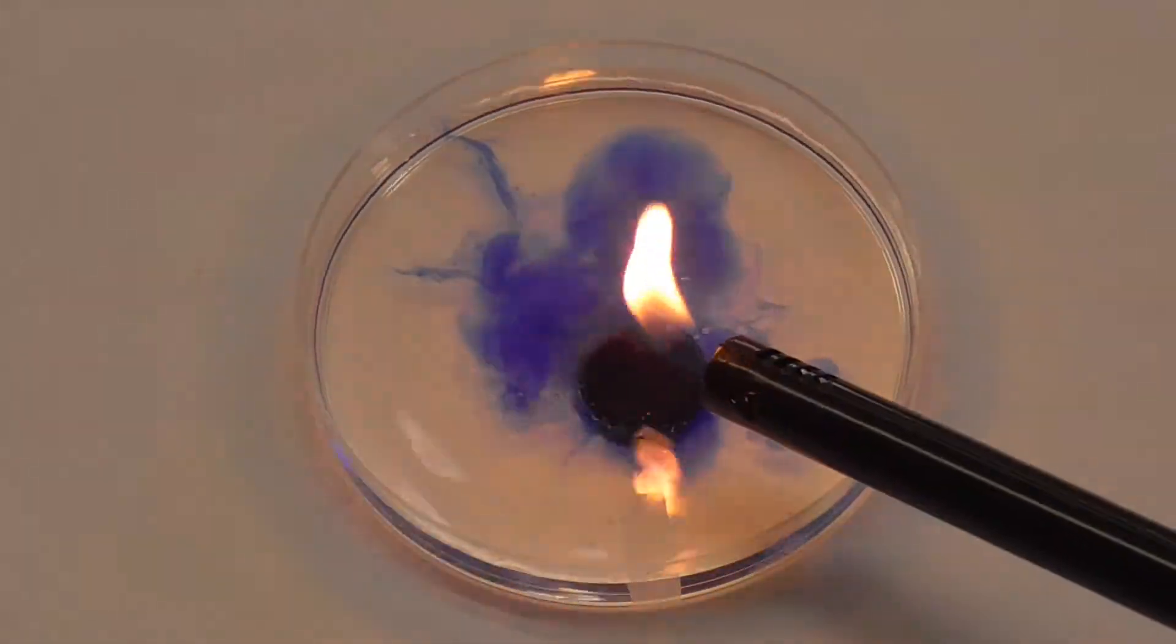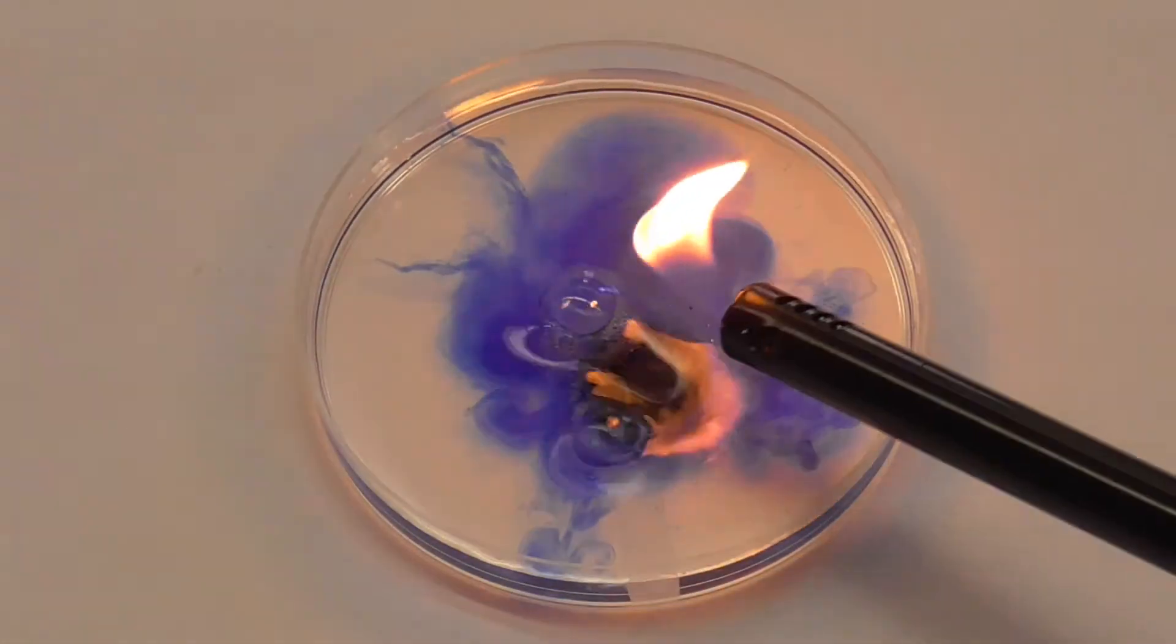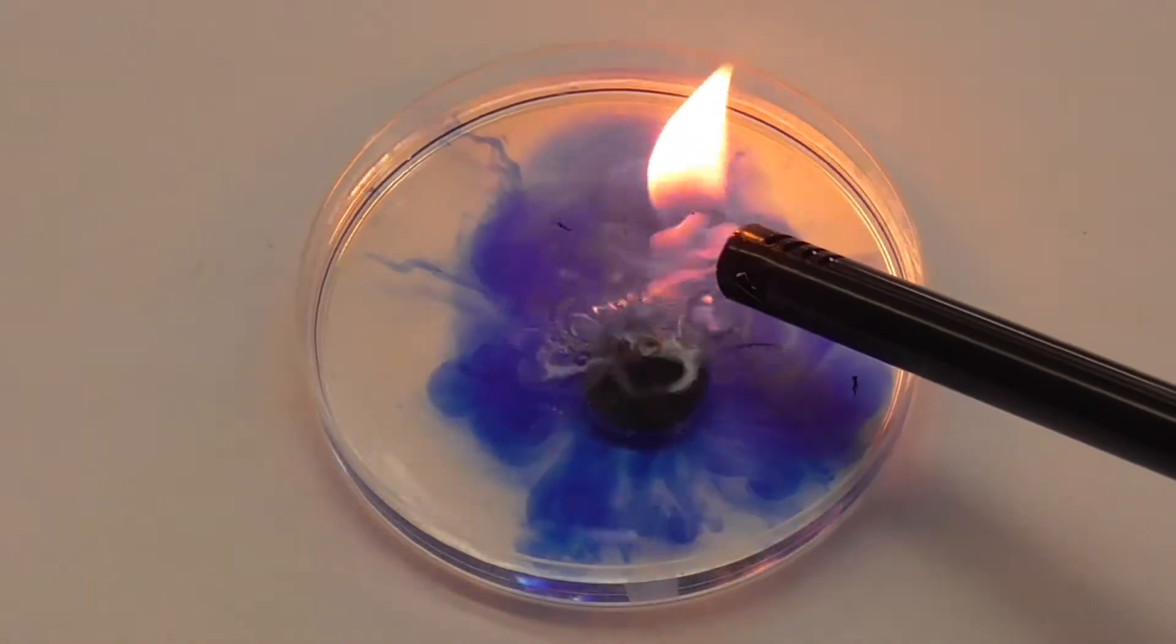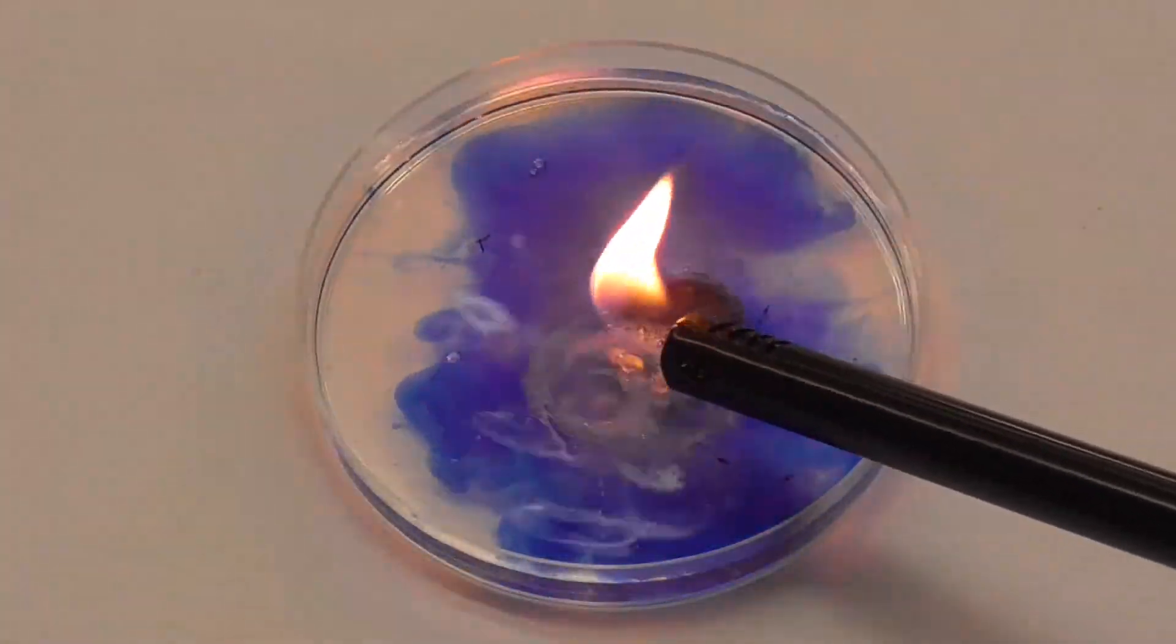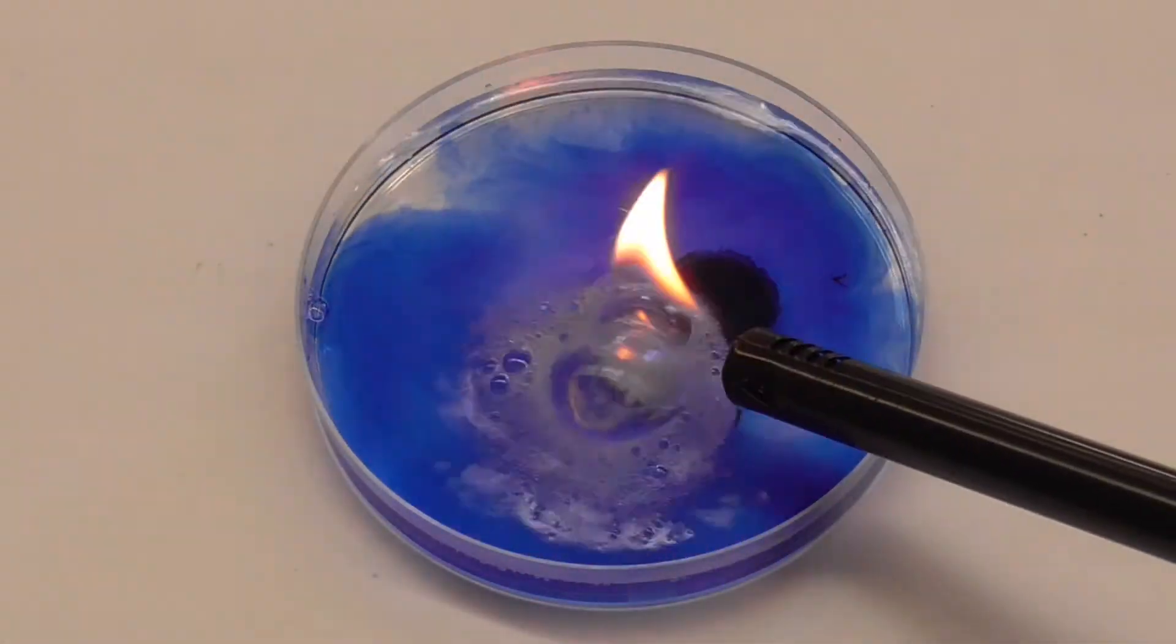And do you hear those tiny popping noises when I heat these bubbles with a flame? Those are tiny explosions. That means that the gas being produced is likely hydrogen. Let's watch closely to see if these flames have a bit of a pink color in them. If so, that's a positive indication for the presence of lithium metal.